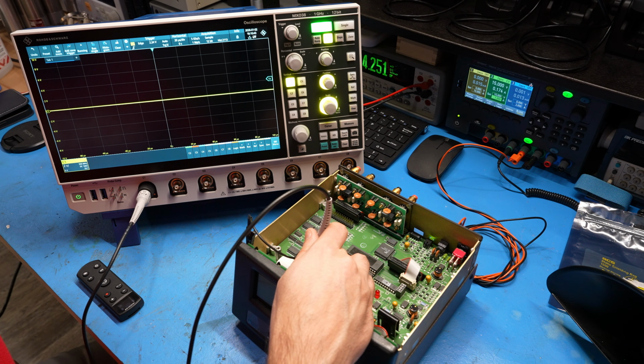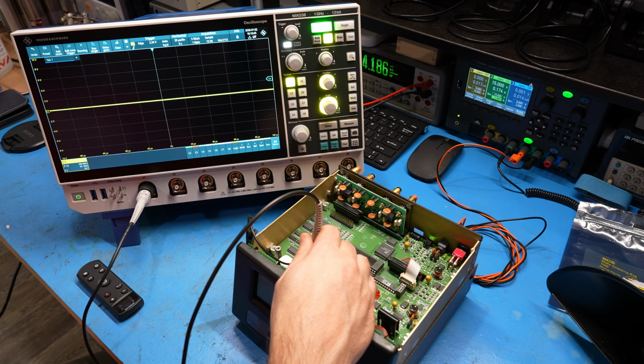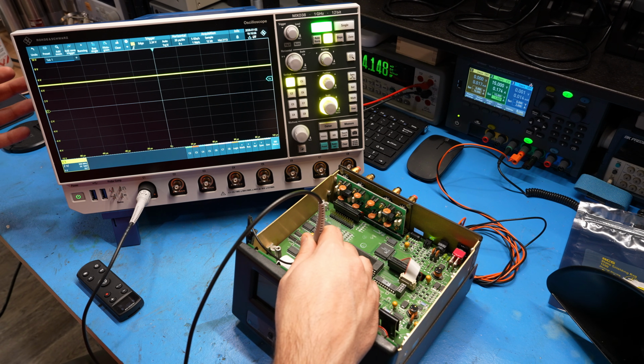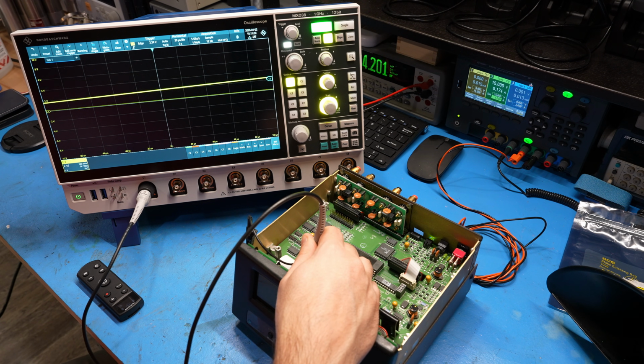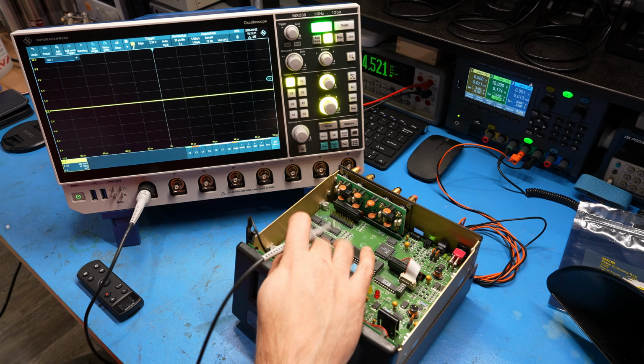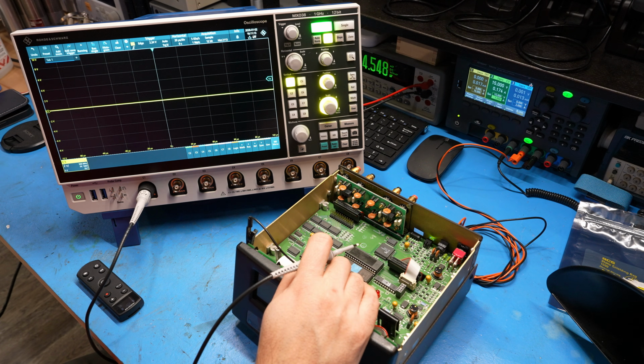Let's tap on that. And let's see what happens. Okay, it's high. Now look at that. It's pulsing it. Okay, so if it's pulsing it, it means that it's doing that because it's receiving nothing from the microprocessor. It basically waits for a certain amount of time. It doesn't get anything. It resets the microprocessor. So you can see that we're in this perpetual state. That's a bad sign. That means that the microcontroller has no activity at all and is not communicating to the management IC. But the management IC is definitely working because otherwise they wouldn't be doing this pulsing. So that's one thing. So yeah, I'm more and more convinced that we're going to have to try and replace the microprocessor and see if that makes any difference at all.